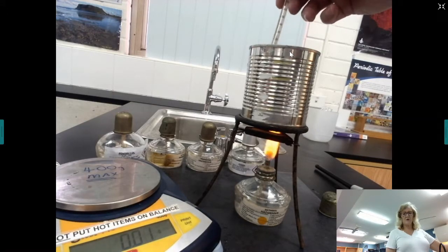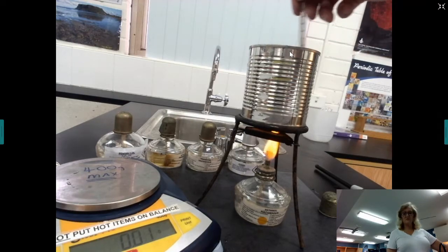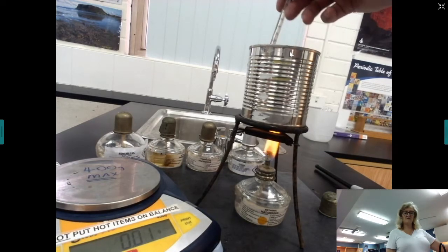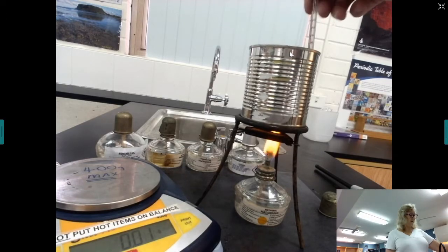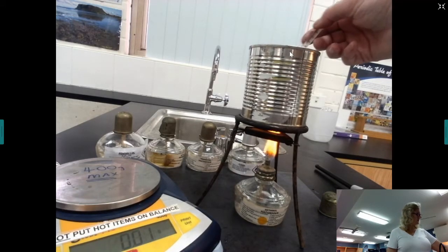This is an experiment where the sources of error are enormous. We will not even get close to literature values. No matter how carefully we do this experiment, we're not going to come close to literature values because there is just so much heat loss to the surroundings. So some of the ways we minimise that heat loss to the surroundings, well, one way is by using a metal can rather than a beaker. I've also got a lower than normal tripod so that the beaker is actually closer to the flame.